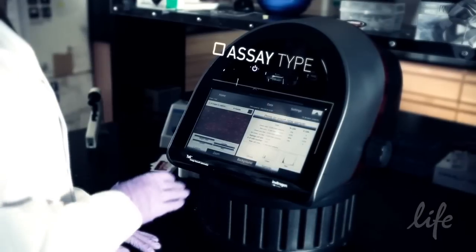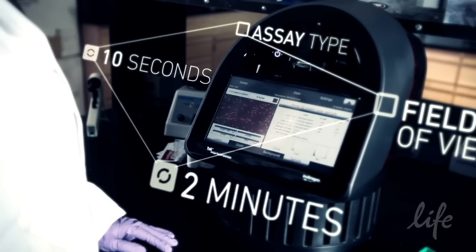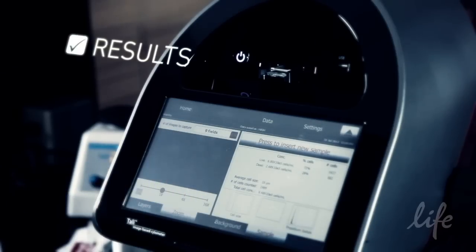Depending on the assay type and fields of view analyzed, analysis can take from 10 seconds to about 2 minutes. Once the analysis is complete, the assay results are displayed on the screen.